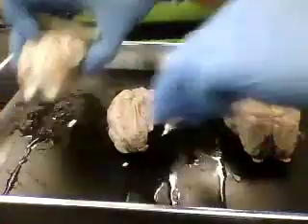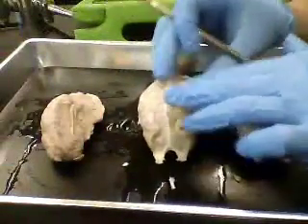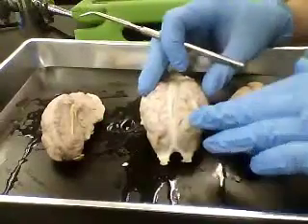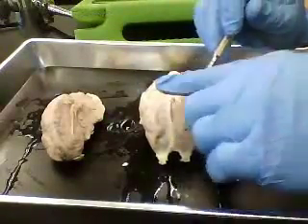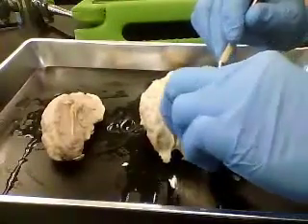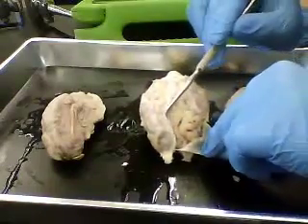Now here we also have another intact sheep brain. The difference is this still has the dura mater, which is the outermost of the meninges, intact. I've cut a little section away so we can flip it back. This is the consistency of like wax paper or saran wrap. You can see that it covers the brain.